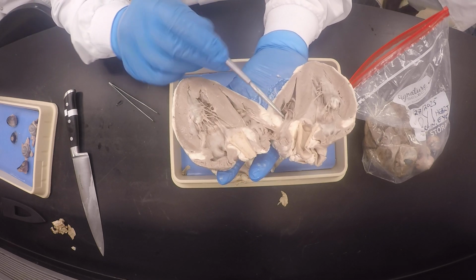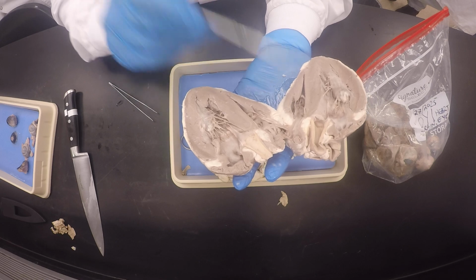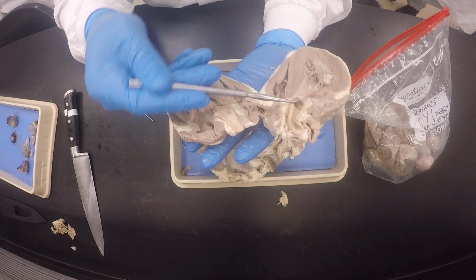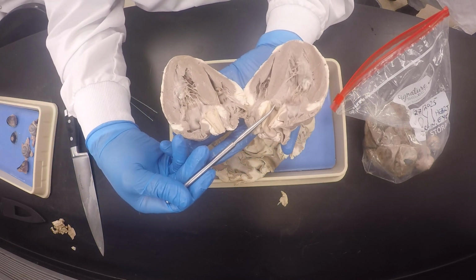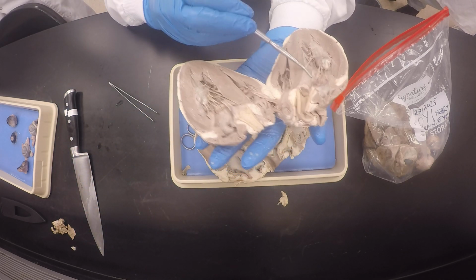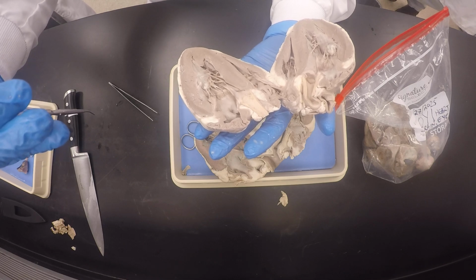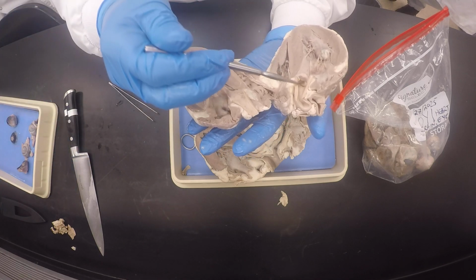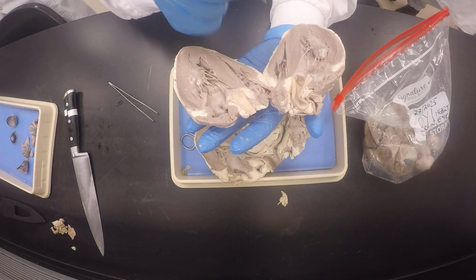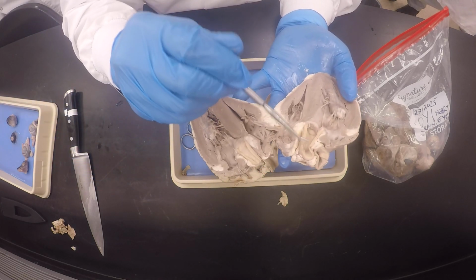Bicuspid, and this one would be the tricuspid. Tricuspid, okay? And this one would be the, you see how the valve is pointing up like this instead of these ones are pointing down. You see how they're pointing down because they're gathering blood and closing up and making the first heart sound, right? These ones, when the blood tries to go back into the ventricles, they will close up. So this one would be, which valve is this? First, what's this blood vessel?